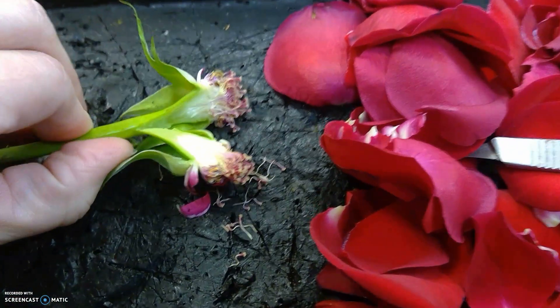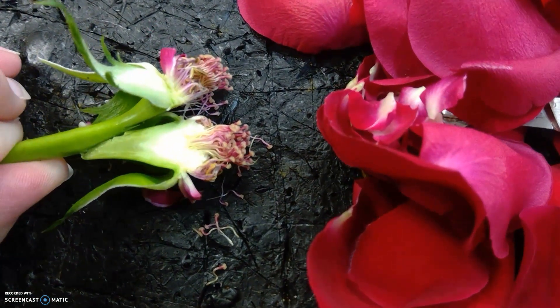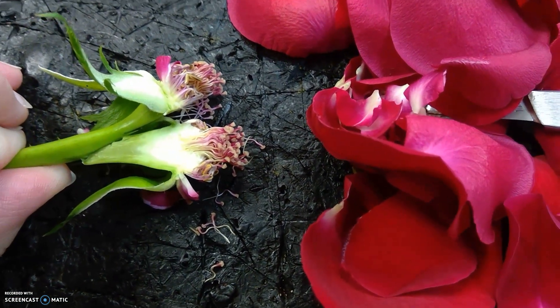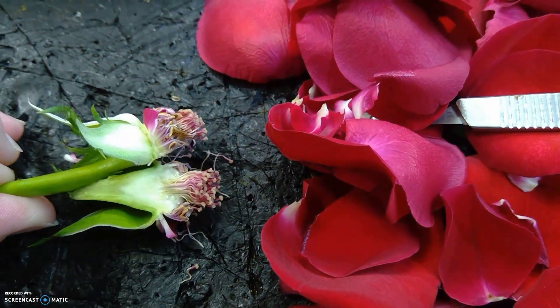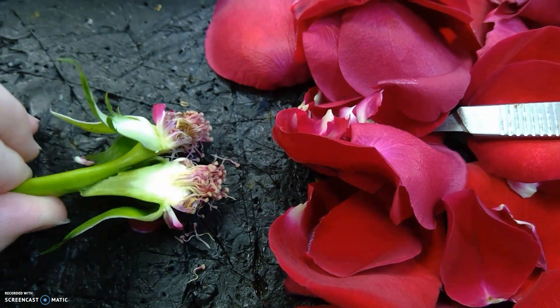I'm going to tip the camera in, and there you go. You see there's lots of these to increase the chances of eggs being fertilized so we can get a new flower. I hope this has been helpful. Thank you.